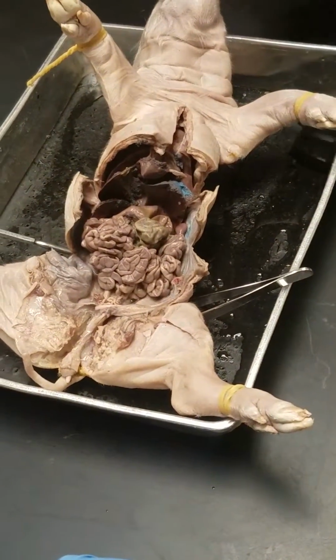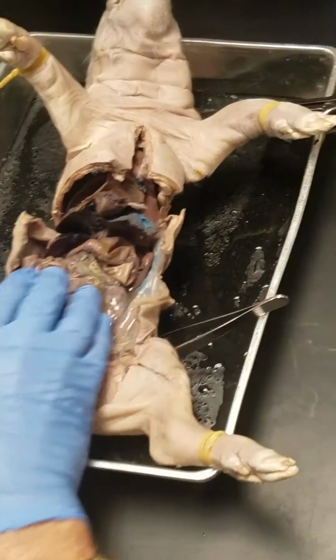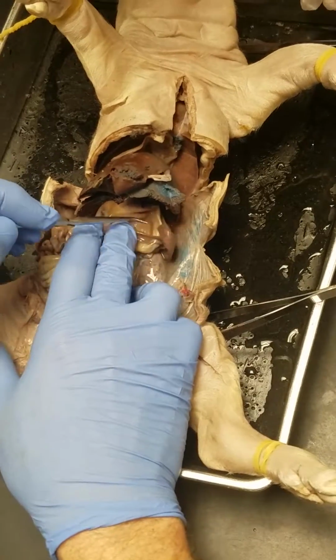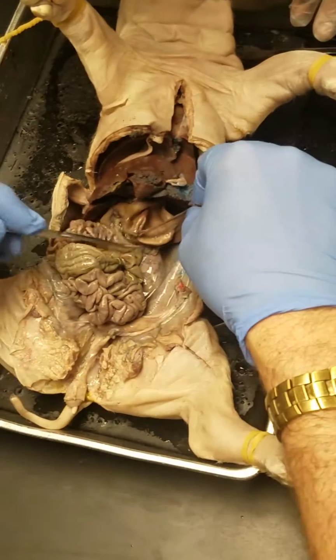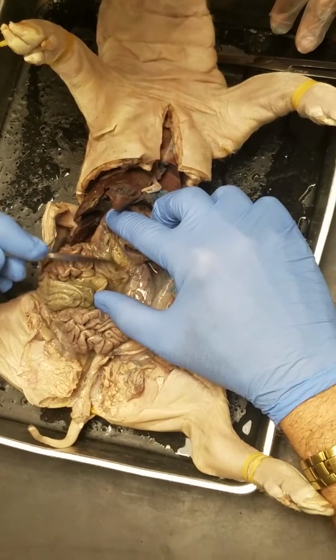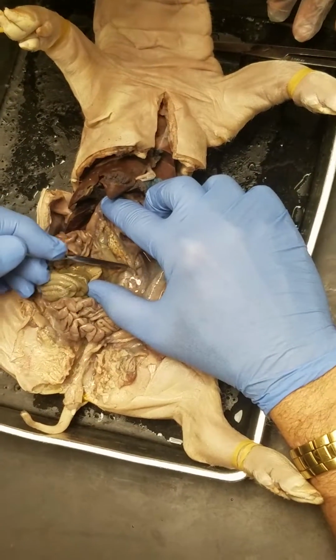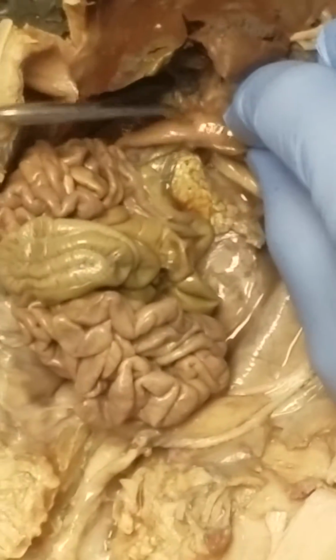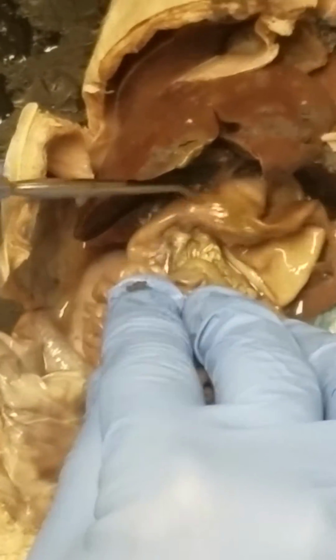Can you go over the stomach and everything to review? So there's our liver. Stomach, which everybody will know where the stomach is. The spleen's over here. Look under the stomach. I forgot to do this the last time I went through this. If you look under the stomach, you're looking for something that looks like a piece of already chewed chewing gum. That's the pancreas. And then pyloric valve. I already did this, so we'll go back this way. So pyloric sphincter, pyloric valve.